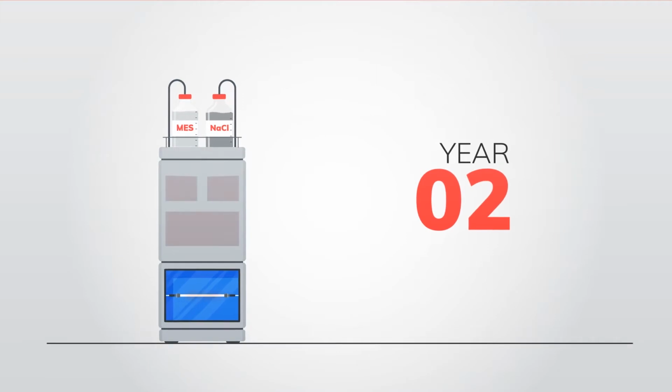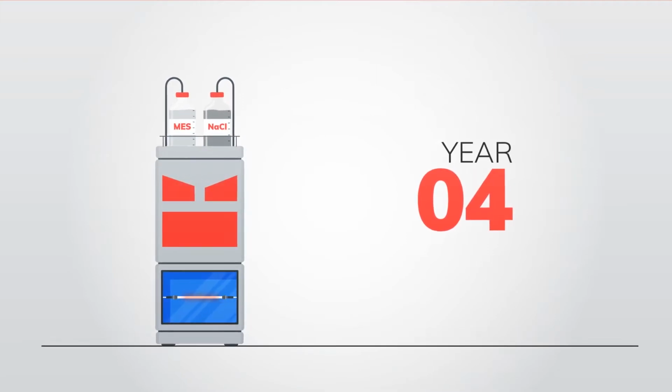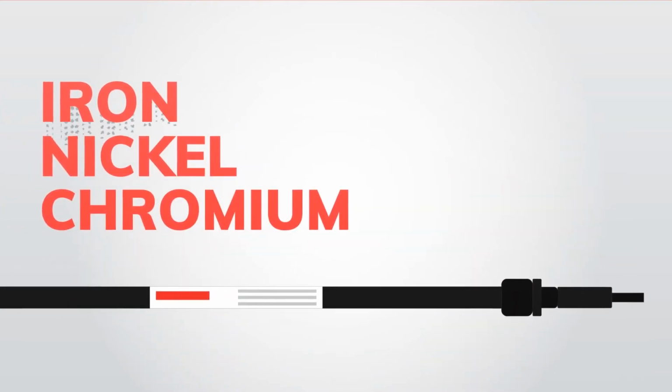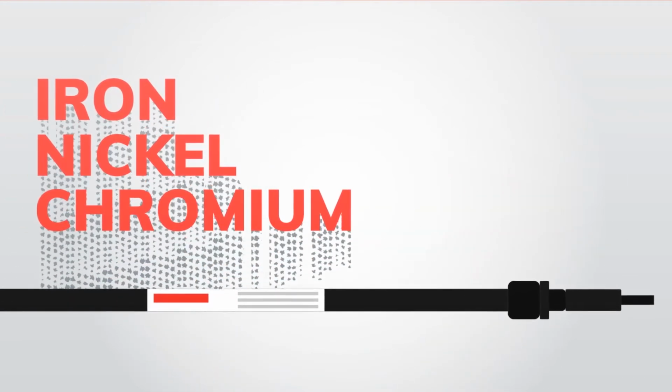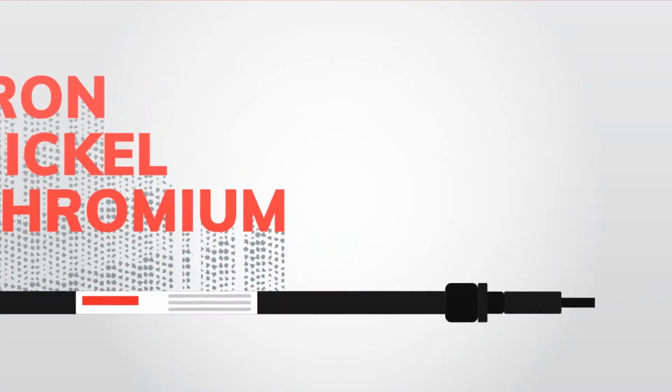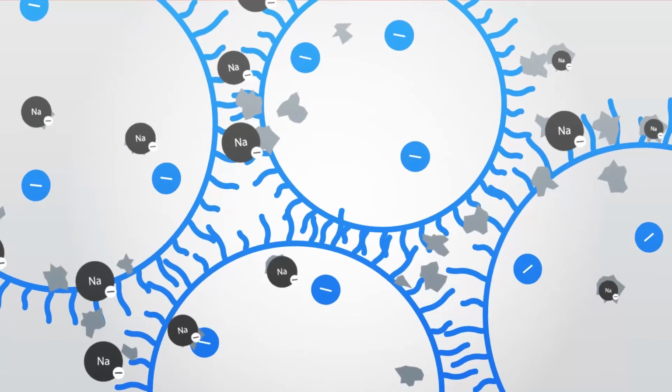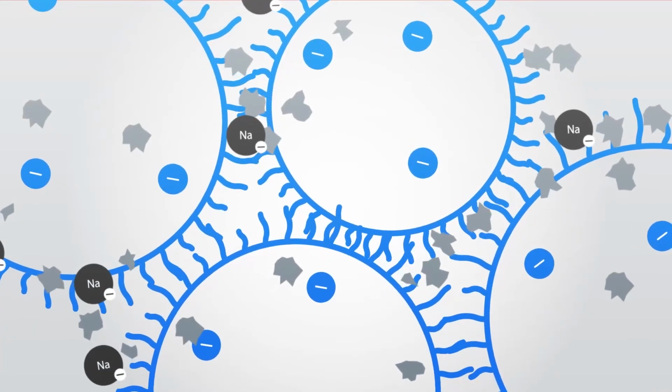After years of use, what used to be a benign stainless steel system may now be an actual column killer. Metals such as iron, nickel, and chromium leach off the system and bind to the column resin. This takes capacity away from the column, crippling its separation, altering selectivity, and hampering your resolution.